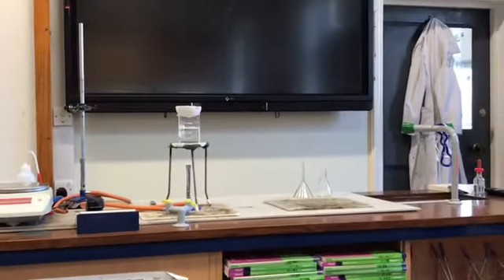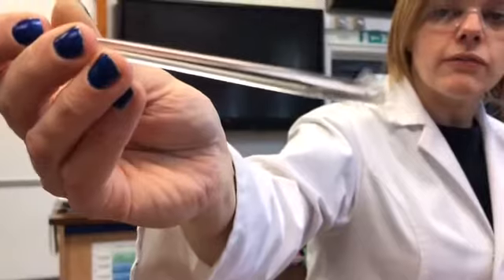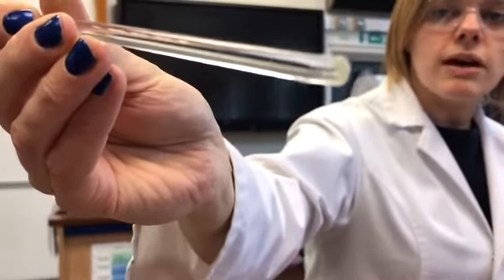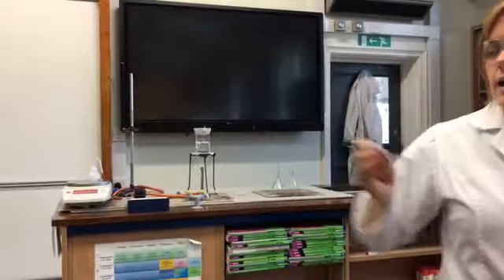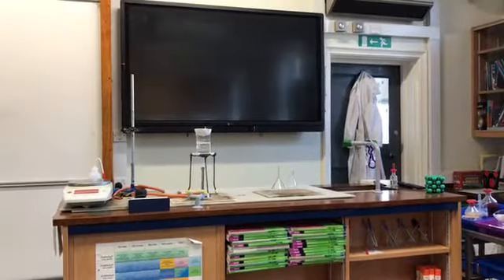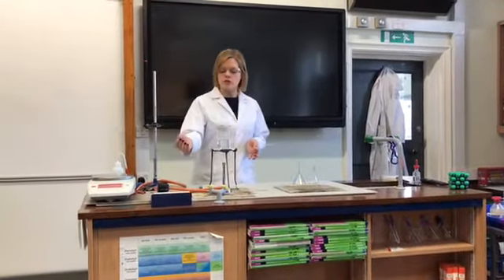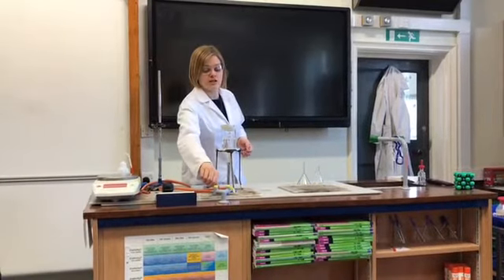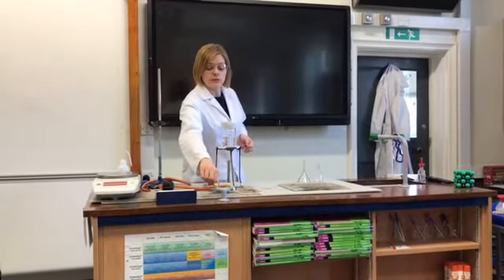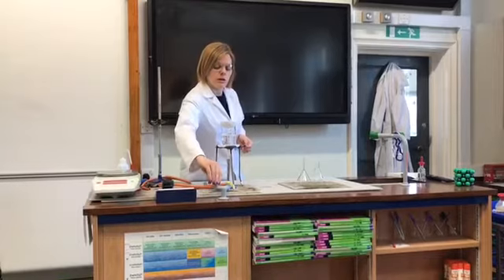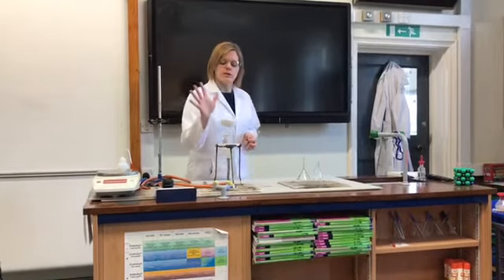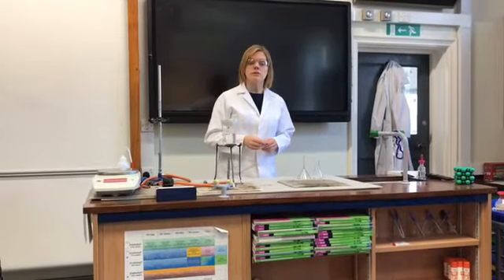And so you can just see at the very end of the stirring rod some crystals being formed just there. So now it's time to stop heating and to allow the solution now to cool and crystallise slowly before the next stage. Turn off this burner and just allow that whole thing to cool and crystallise slowly.